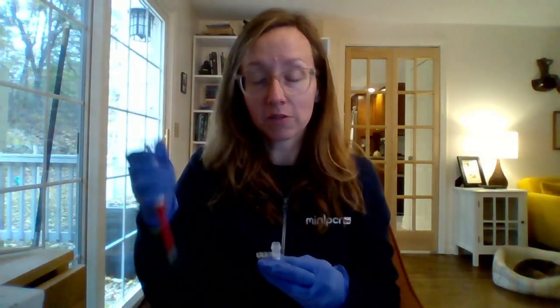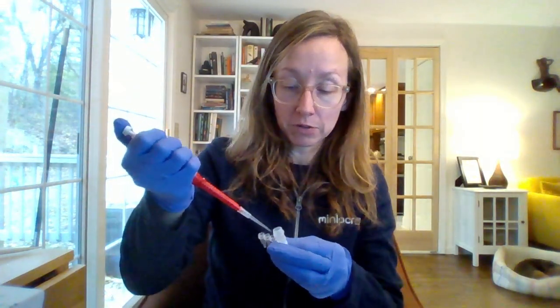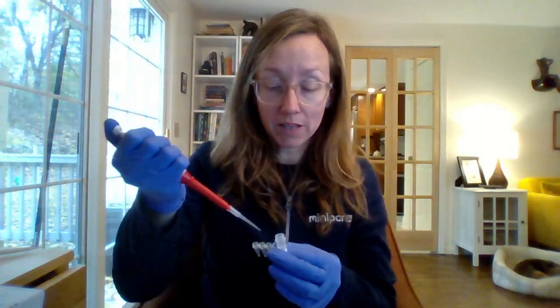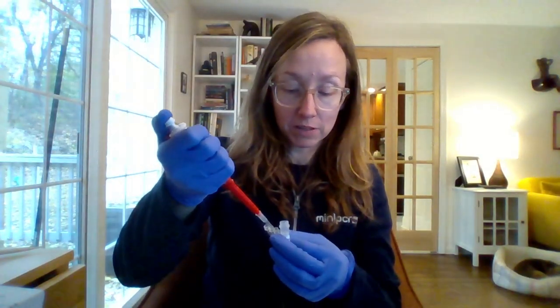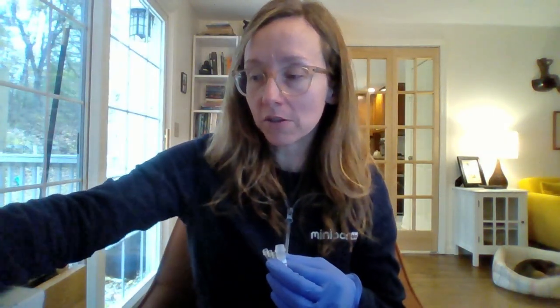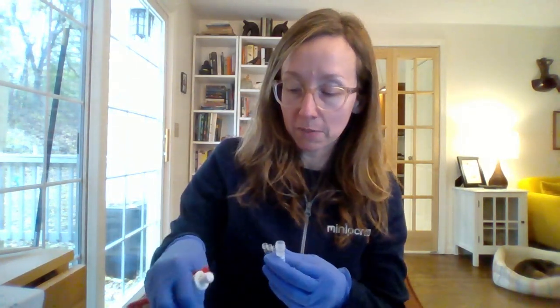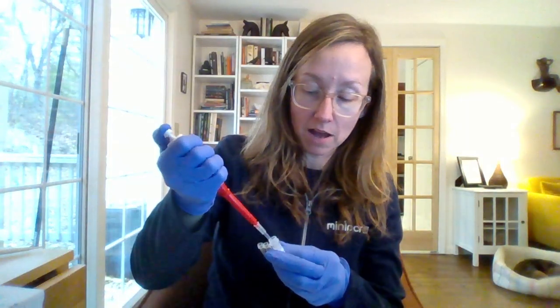A full day of pipette practice is great. 20 minutes is just fine. Something to get them comfortable pipetting before you turn them loose on the lab. It'll pay off in the form of better results. They'll get better results. They'll be more similar to the expected results. They'll be easier to interpret. So definitely recommend investing in some pipette practice before undertaking this lab.